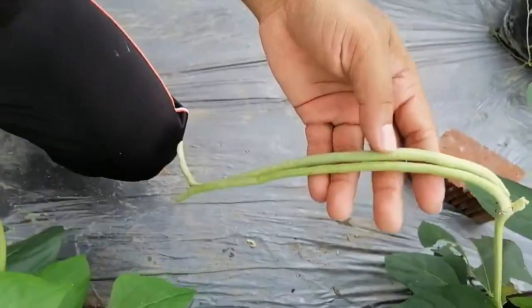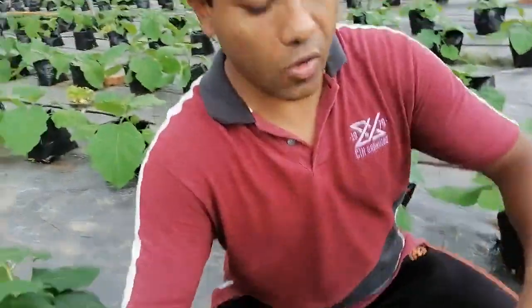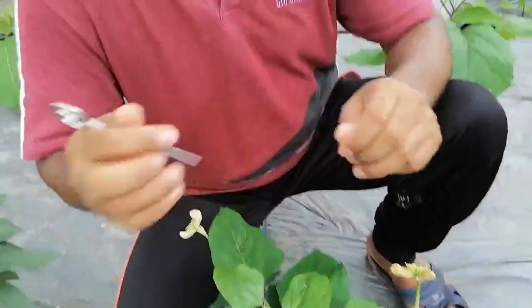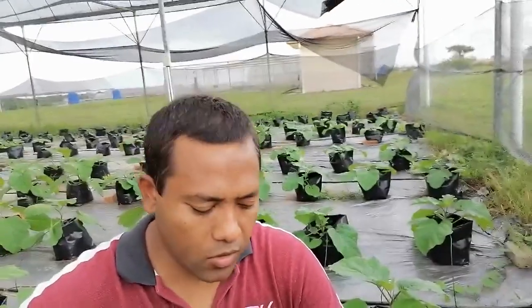The flowers of yard-long bean, mung bean, and other pea plants are leguminous and papilionaceous. They are usually cleistogamous, meaning pollination is already confirmed when the flower opens — they are self-pollinated. So you must do the emasculation before the flower opens, that is one day before. If the flower blooms tomorrow morning, you do the emasculation today morning and bag it.